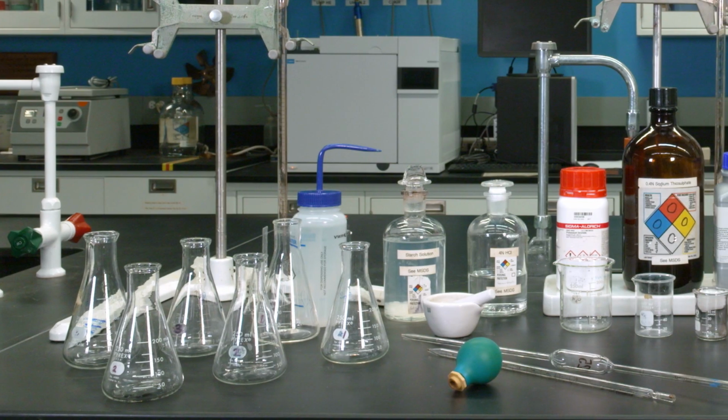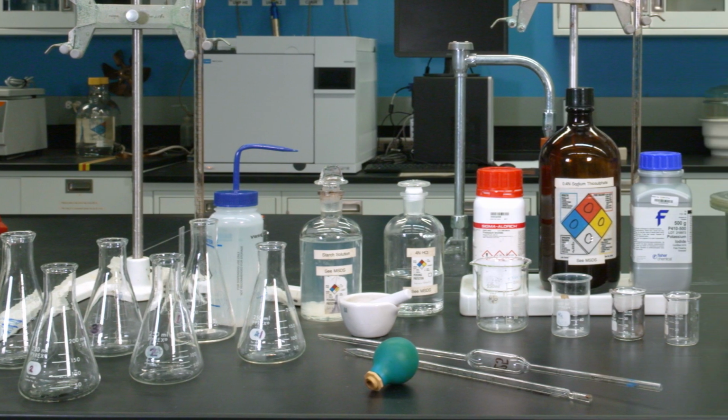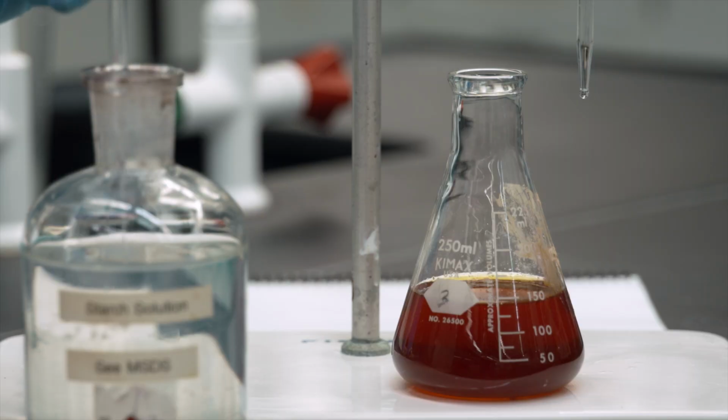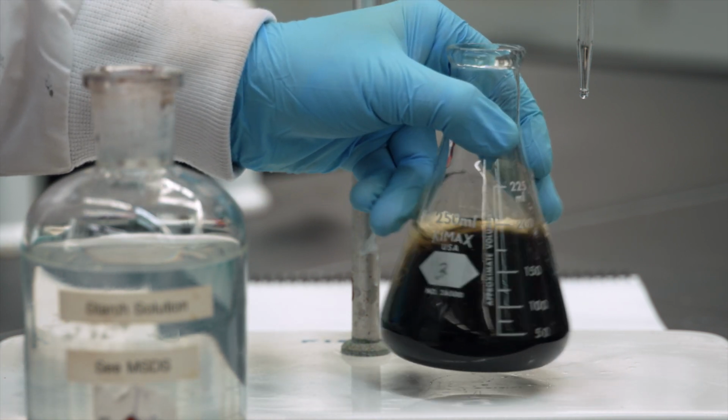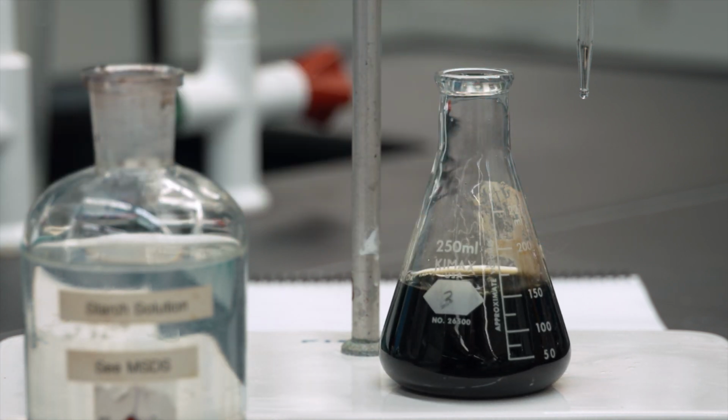This experiment will give you hands-on skills that are used on a day-to-day basis in an analytical laboratory. It will help you improve your pipetting, recognize qualitative differences, and know what chemicals are to be used at certain points in reactions. We have a fair amount of tips for this experiment, so let's get started.